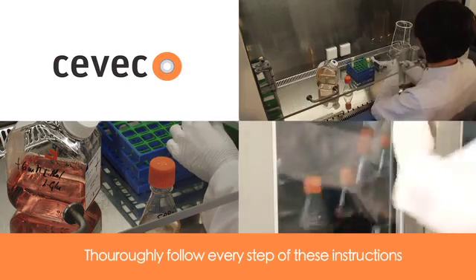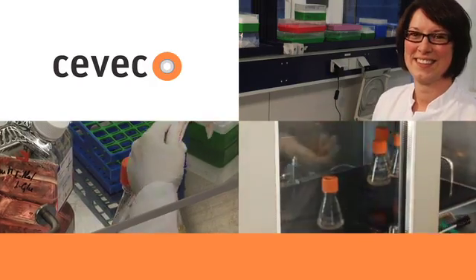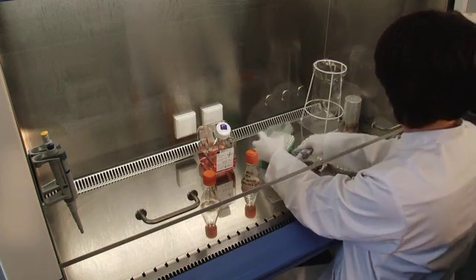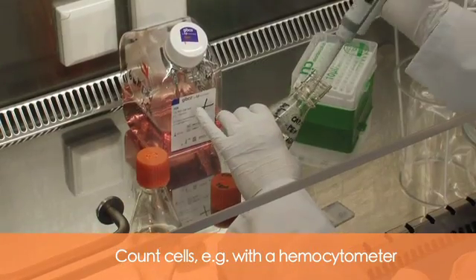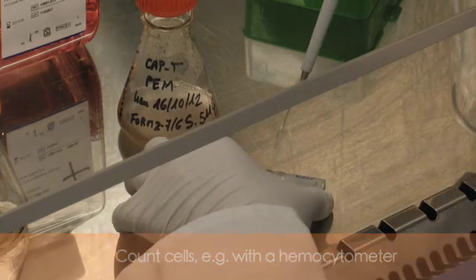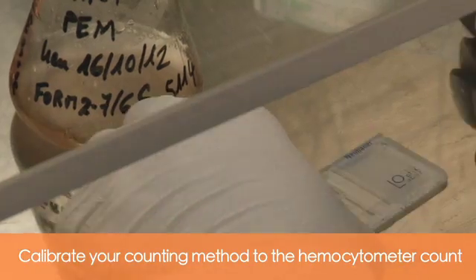If you thoroughly follow every step of these instructions, transfections and expression of your protein of choice will undoubtedly be a success. As a first step, count cells by a method of choice — for example with a hemocytometer. Due to slight differences between counting methods, calibrate your counting methods to the hemocytometer count.